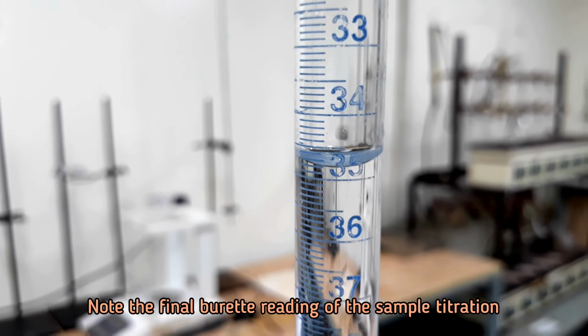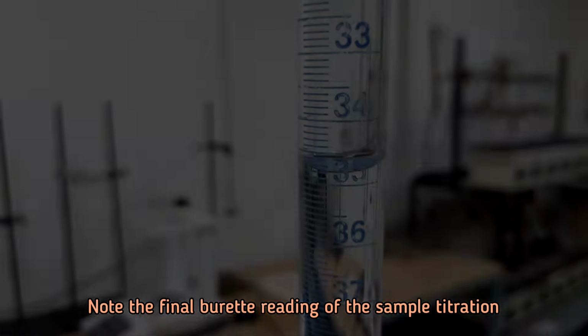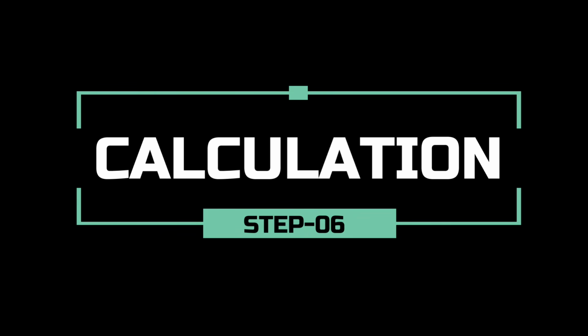Note the final burette reading of the sample titration. We are in the last step.